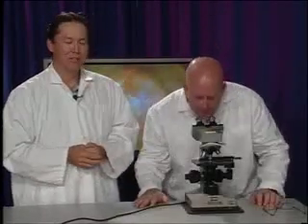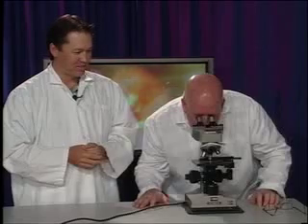So this is 10, right? And 10. That's 10. So I'm looking at this 100 times its normal power. More than normal. I like it. I think I'm ready for high power.